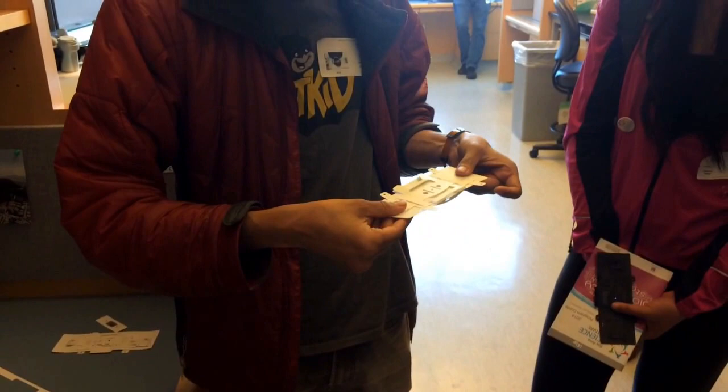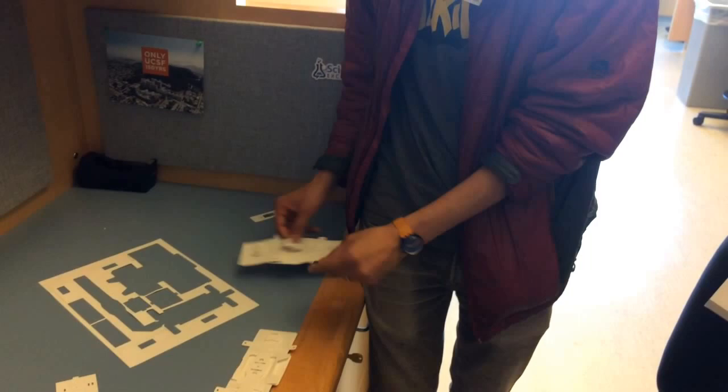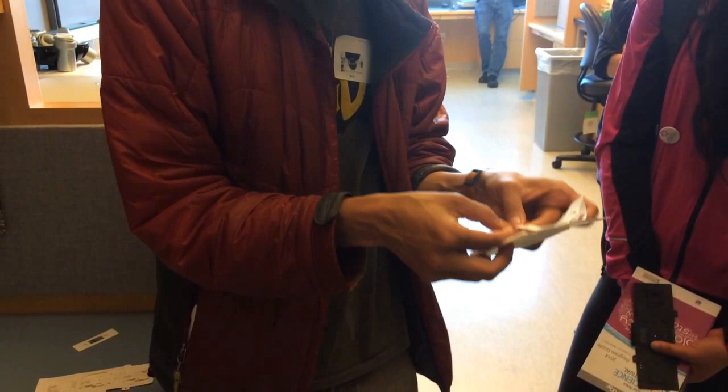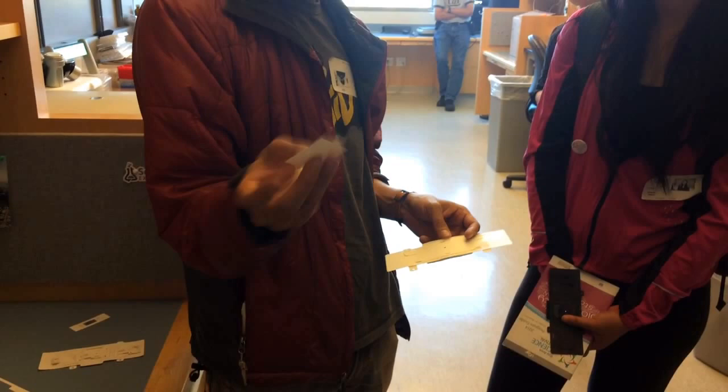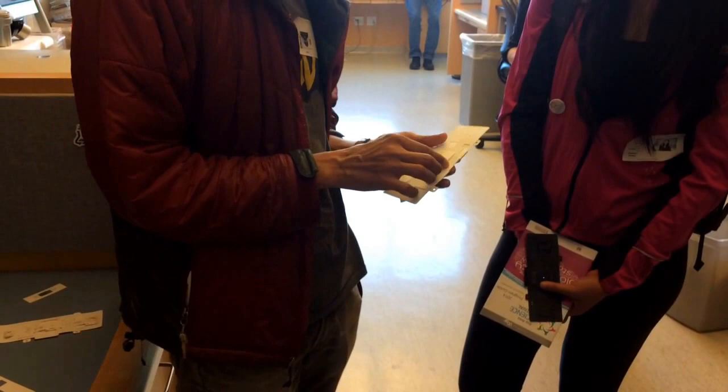So clearly this has no optics. So one of the things that it does is, depending on the types of microscopes you're making, the kit basically comes with many different types of lenses that you mount, and that, for example, finishes one of the microscopes. And then in the kit, there is another module. So you see these pieces are missing. This is the module that fits the LED that we were talking about, that mounts here. And then this piece mounts there. And that basically gives you the light piece. And then the LED and the light module mounts to this piece.